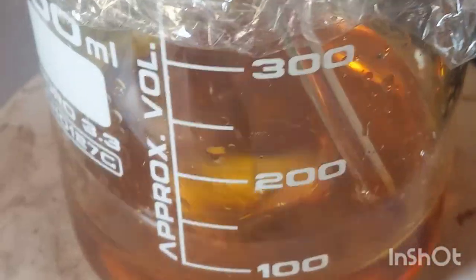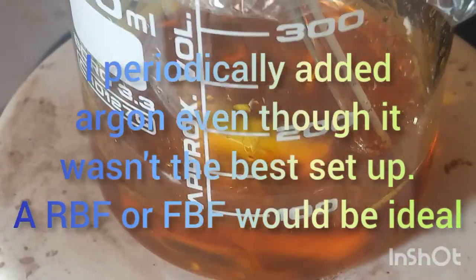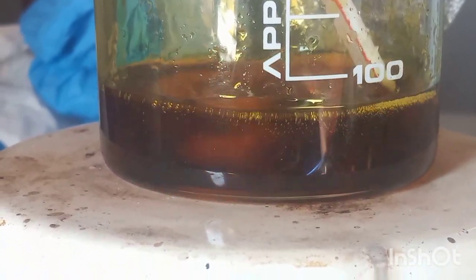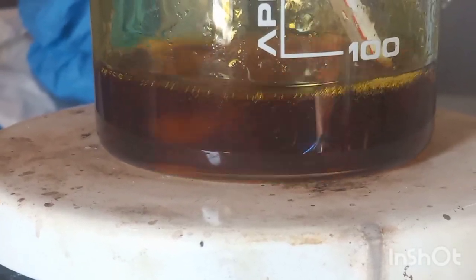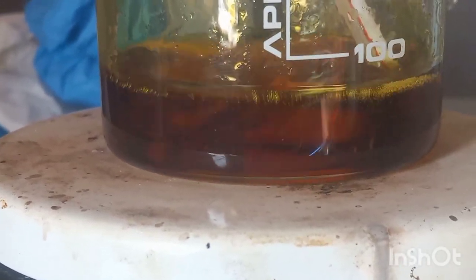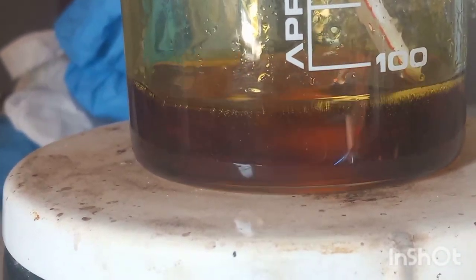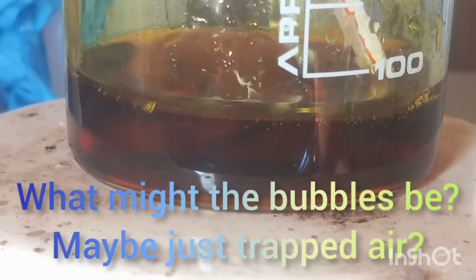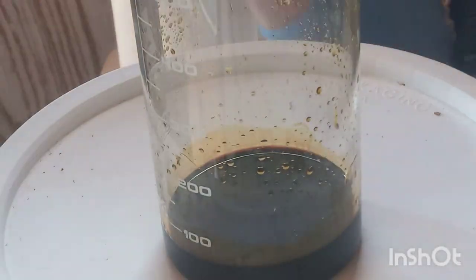55°C — beautiful color. Everything's virtually dissolved and we've got a syrupy, dangerous liquid. There is possible gas generation — ethylene, maybe? No idea. Not at all sure.